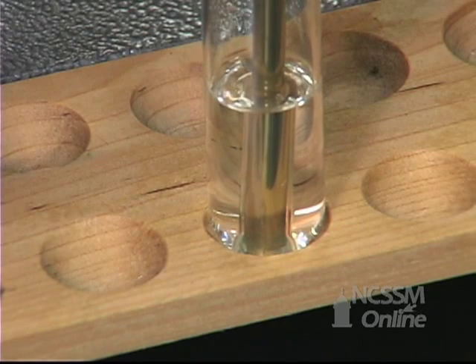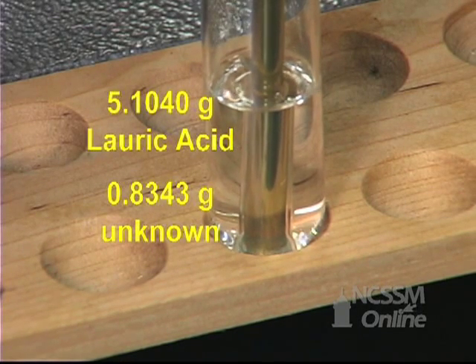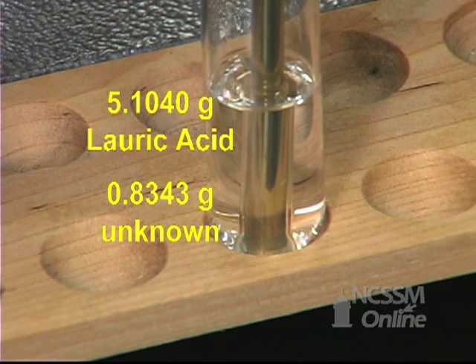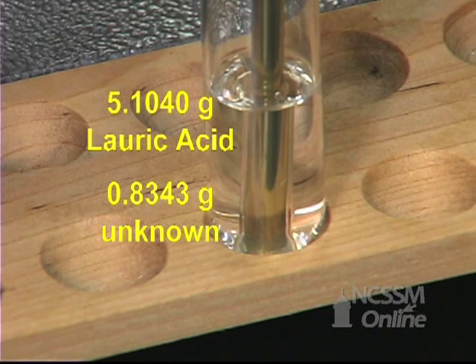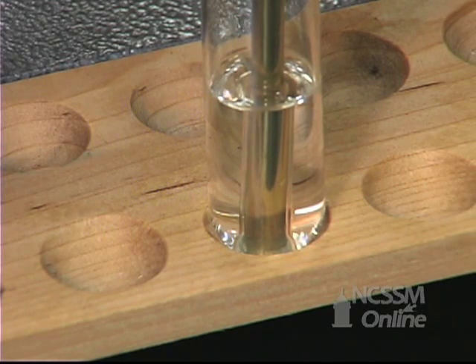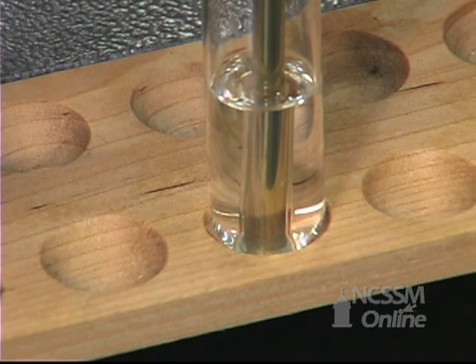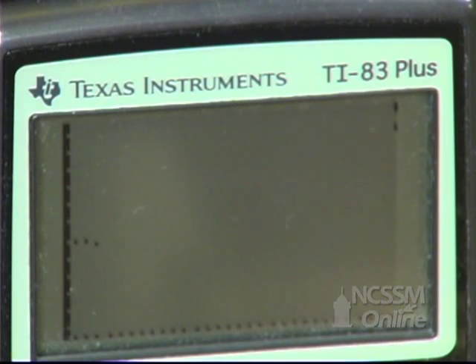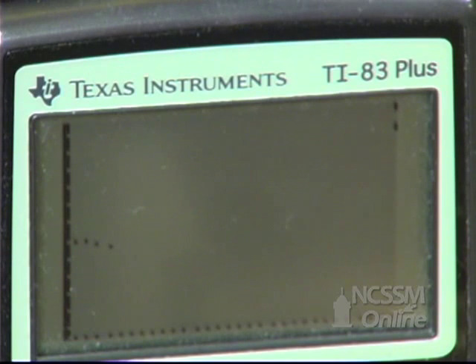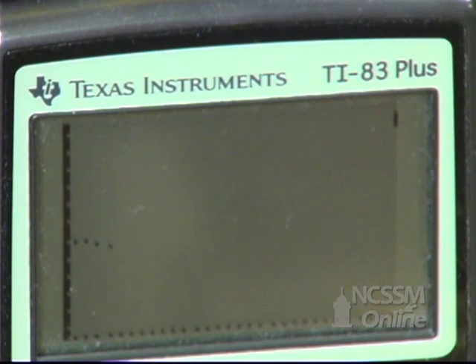We've melted the lauric acid and dissolved our unknown in the lauric acid. We will now record the freezing point of the solution. We'll use the CBL again to monitor the temperature versus time to get the freezing point of the solution.